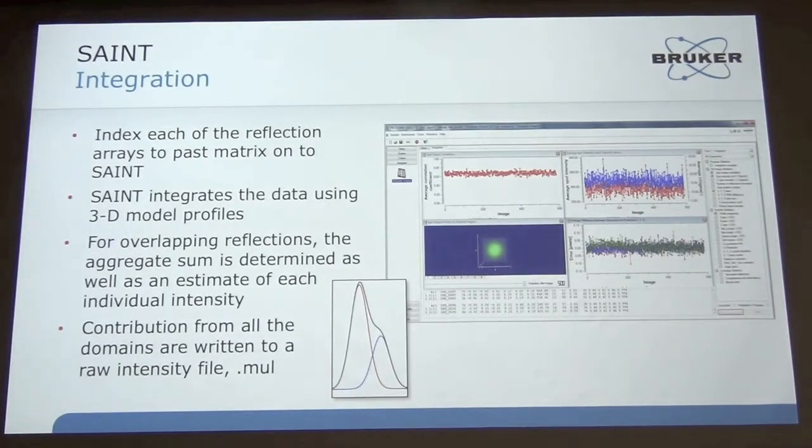So because I've already indexed and have the orientation matrix for both domains, I can go right into the integration. So this is passed on to SAINT. SAINT does a three-dimensional model profile in a similar way that XDS does. And so it's important, I think, for twins that you use the three-dimensional approach because you can actually build model profiles for each of the spots.